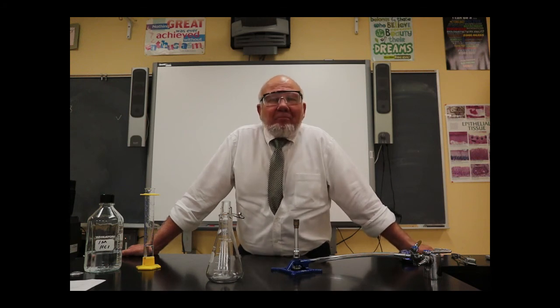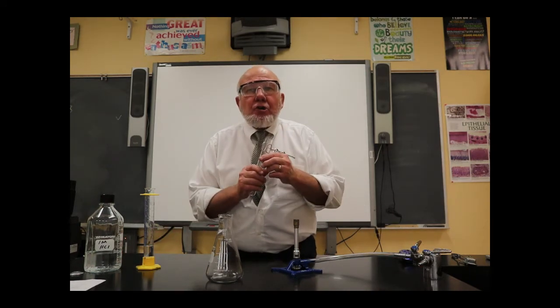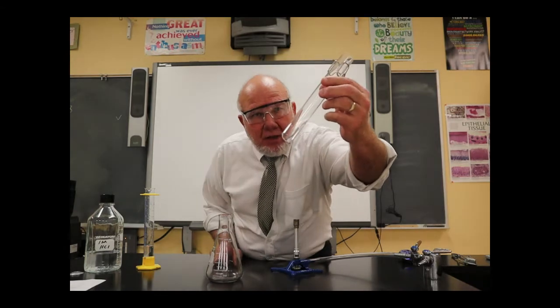Hello. Well, I want to do an experiment for you. I want to react magnesium metal with hydrochloric acid to show you how reactive magnesium metal is.